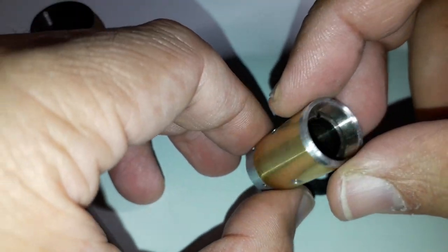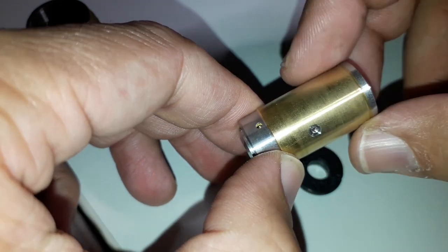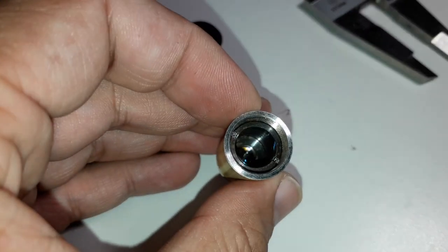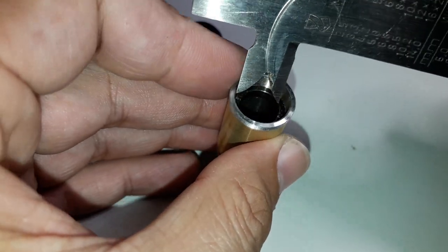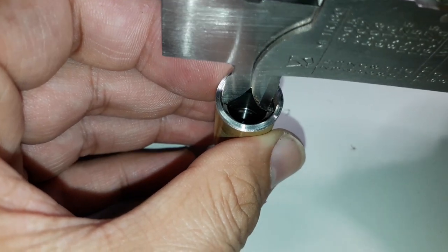The next question is: how can I take this one apart? Actually, it is made of one piece — it has different colors, but it is one piece. What I'm doing right now is I'm again using the caliper to remove this inside ring, the same way as before. This inside ring was made of metal.